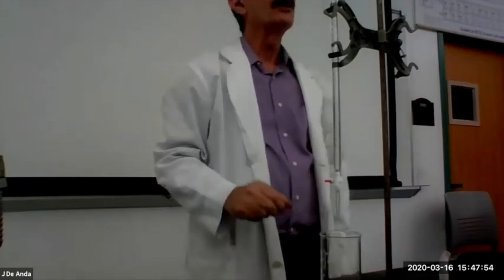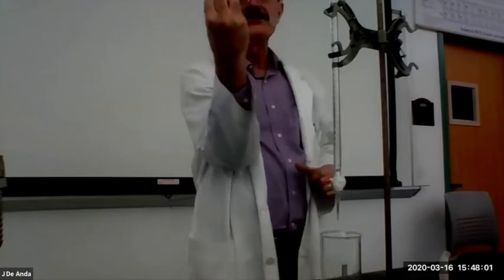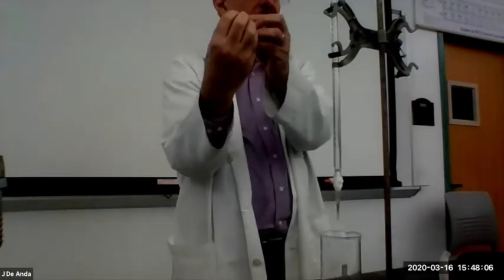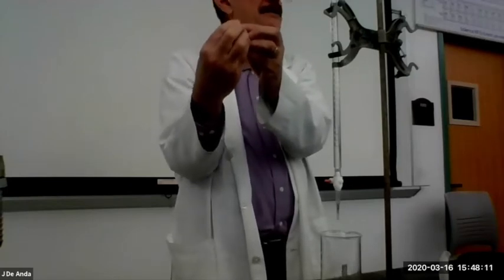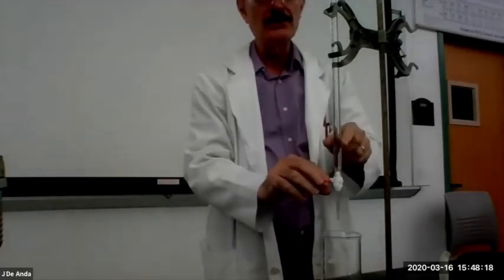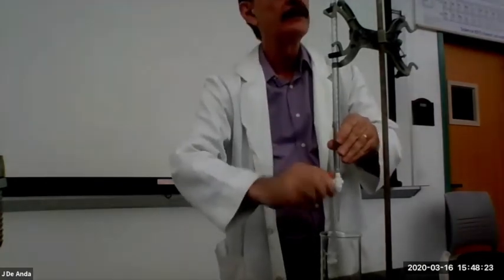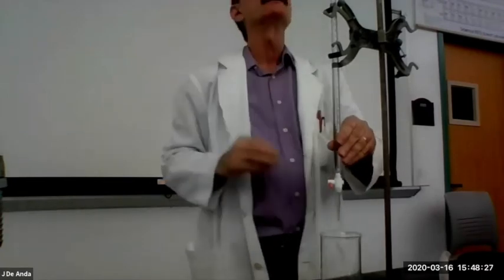And the other one is, because water has this property where the molecules hold on to each other, when you simply let gravity pull a stream of water down, it holds on and it forms a big drop. If you form a big drop, that means that the amount you're delivering might be a little too much for what you're trying to accomplish. So to get a micro drop, what you do is you do a very quick 180 turn of the valve, and what that does is it squirts out a micro drop. That way you can control it a little better.